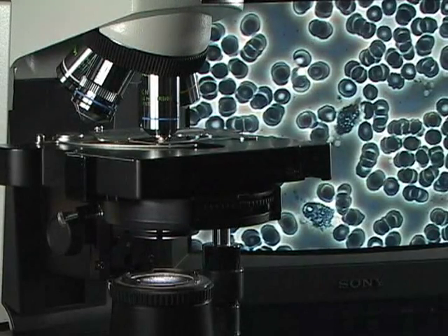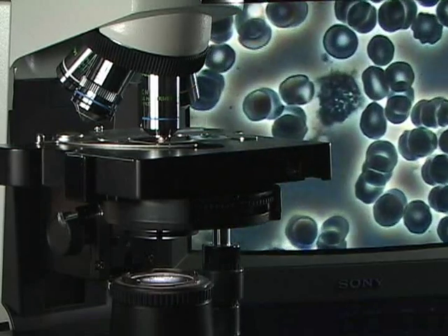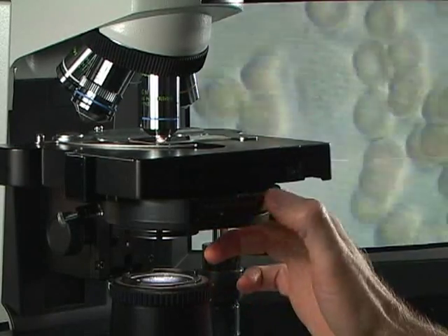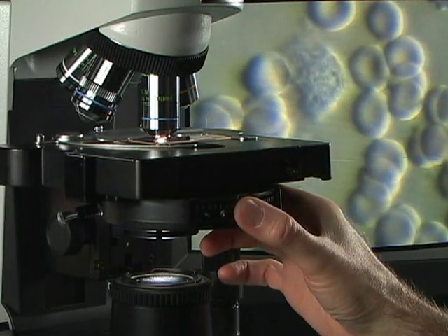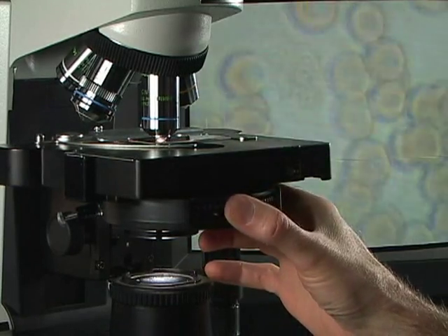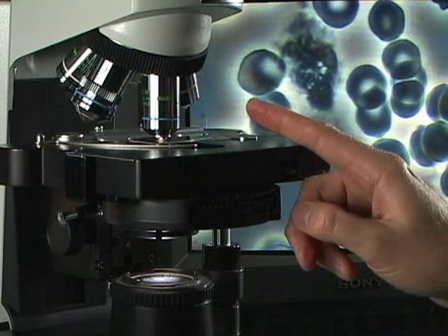For day-to-day clinical work, we often will just use a 40x non-oil objective. This gives us a lot of versatility. If we have an optical zoom system, we can simply zoom in on what we're looking at. We can take our turret condenser, rotate it, and get a nice dark field view. If we want a three-dimensional perspective, we can just shift our condenser slightly and get that nice three-dimensional perspective. And we can flip it back to phase contrast. So we have a number of different views available to us with a 40x non-oil objective.